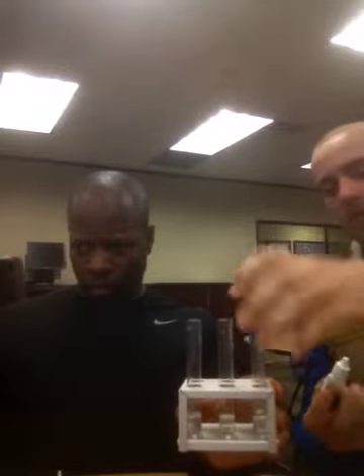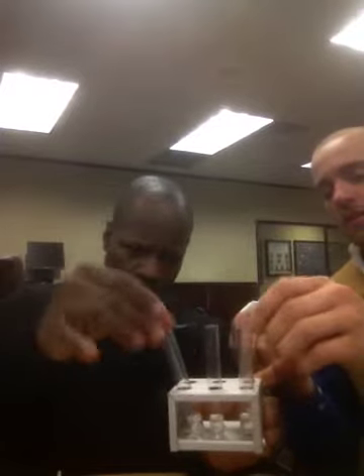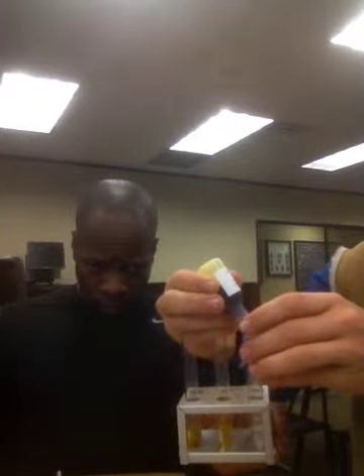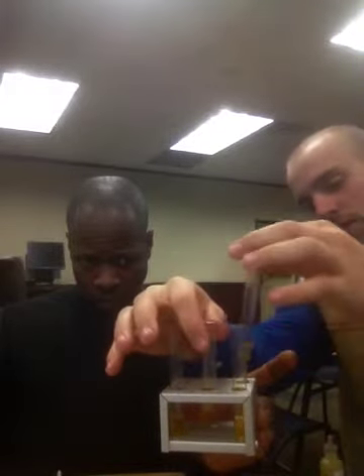We then have our PVP iodine stain. We're going to add our iodine indicator — 1, 2, 3, 4 drops. Let's see what we get here. I'm reading just about the same reaction in each one of them, so it seems that the acidity level doesn't affect it at all. Thank you very much. Have a good night.